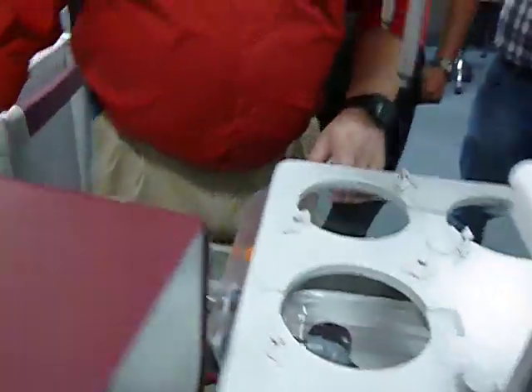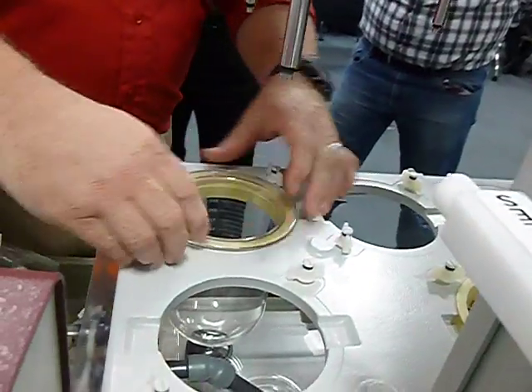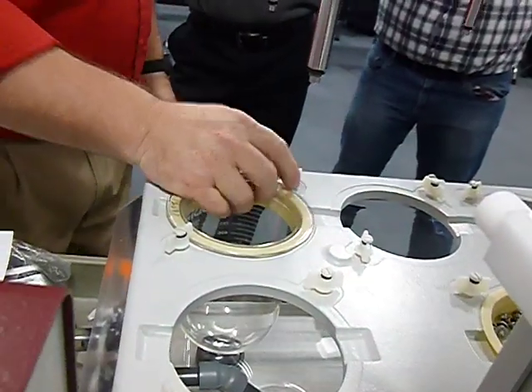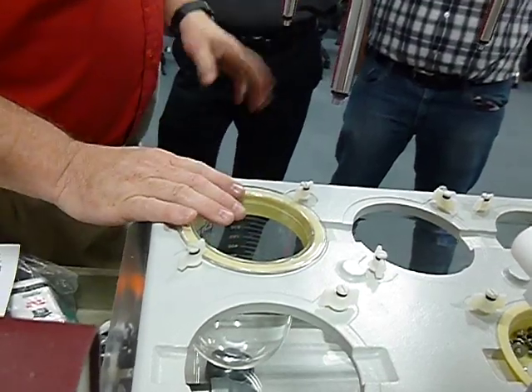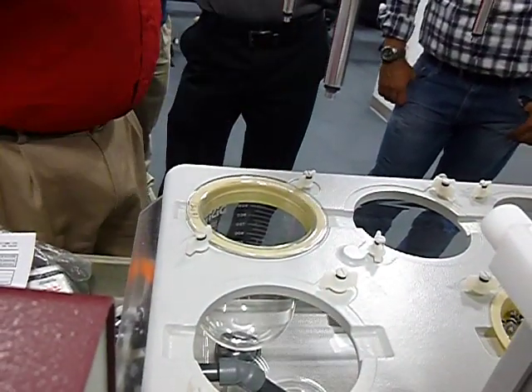There we go. Ideally, that's how they're supposed to work. And then it comes over and it should hold it down inside. You can move this around with some pressure, but it should hold it nice and firm. Basically what it's trying to do is hold it in place. It doesn't need to be over tight, because the whole purpose of it is not to slam this down and hold it to where it doesn't move. The purpose of these is to hold it from the buoyancy of the water from coming out of the position.